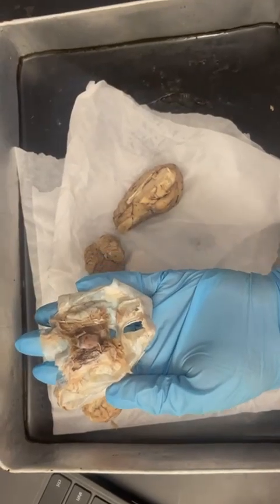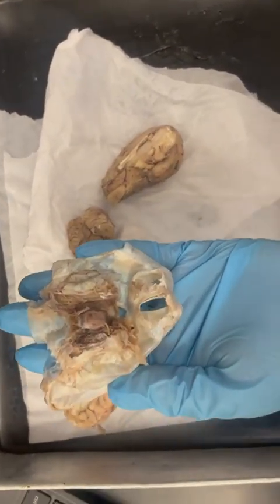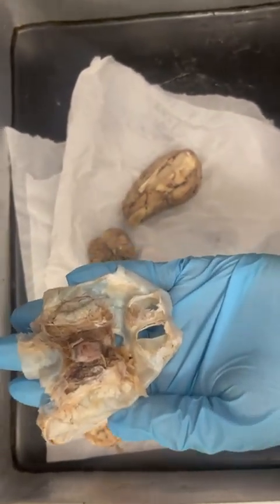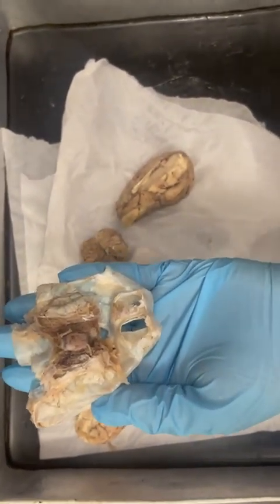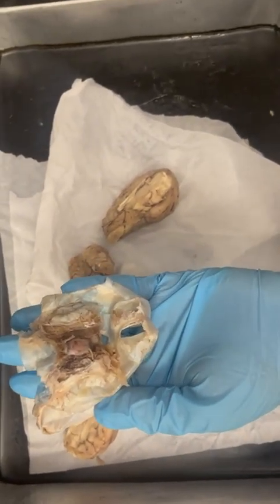When looking at the meninges during a dissection, you can usually see at least two of the layers pretty clearly. The first one is the dura mater, which is the outermost layer. It feels really thick, tough, and kind of leathery, like it's seriously there to protect the brain from injury. It doesn't tear easily and it feels more solid compared to the other layers.